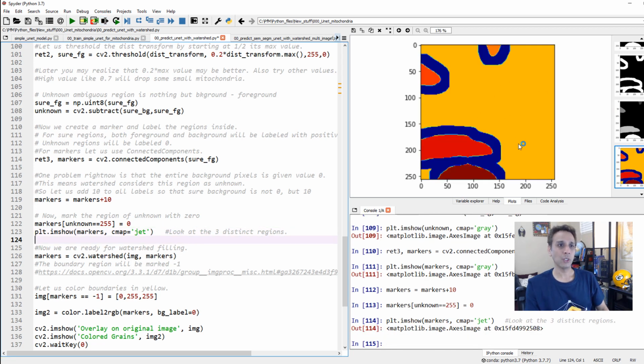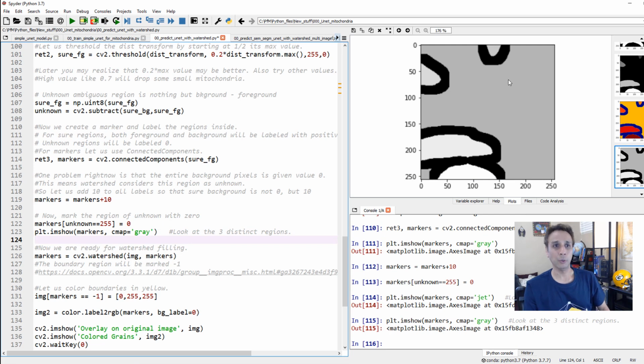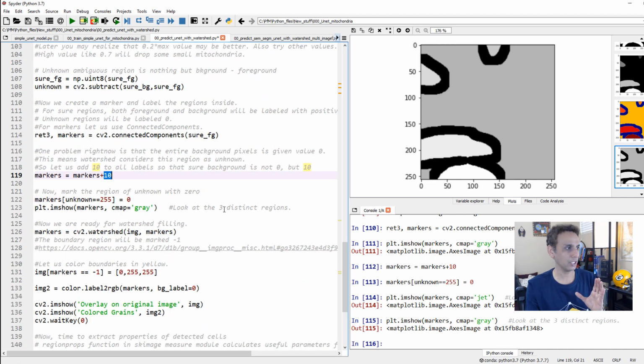So there you go. You can change the color map to something else, but let's go ahead and change this to gray. Maybe it makes a bit more sense in gray. Okay, so the background, we have a value of what? 10, because we added 0 plus 10. This is 11, this is 12, 13, and 14, and the areas where we need help from Watershed are all 0. Okay, so far so good.